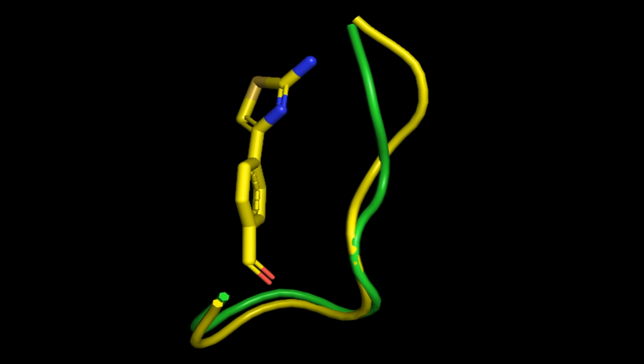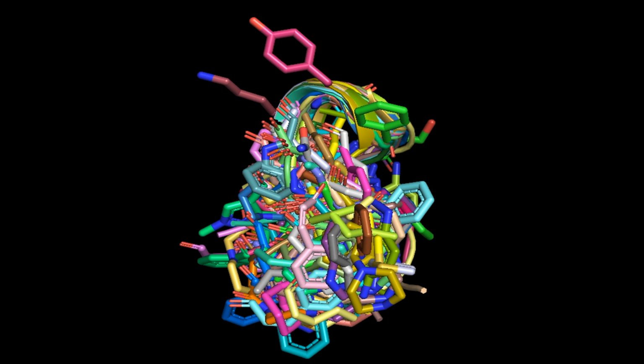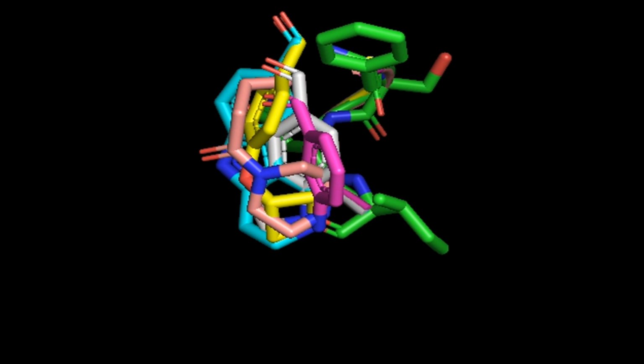Next, let's take a look at the output from the auto-slicing alignment. Unlike precise alignment, auto-slicing alignment has overlay results for loops with different fragments, and you can check them one by one, but here I will only use the first one as an example.